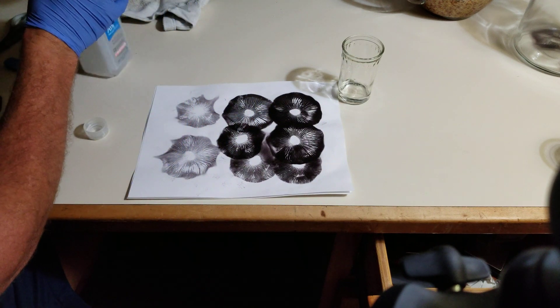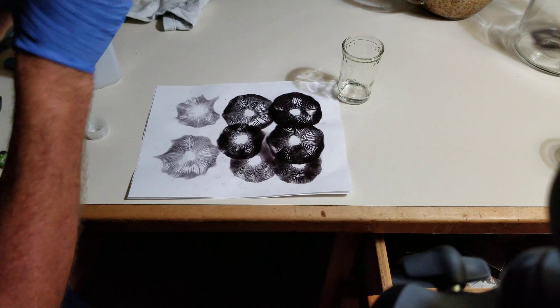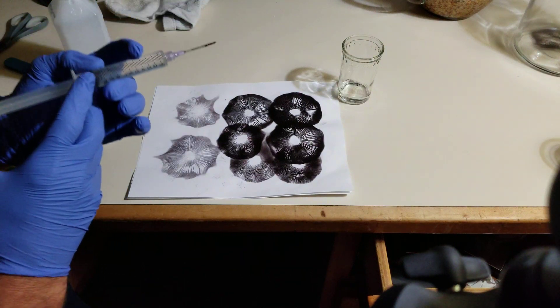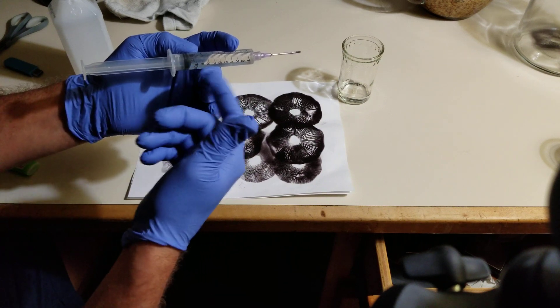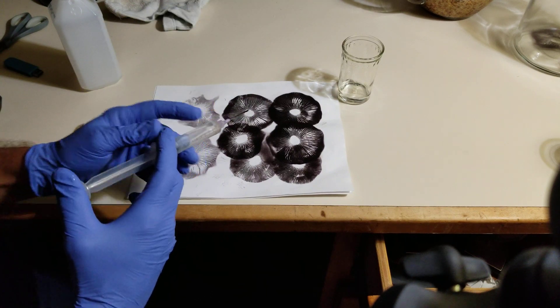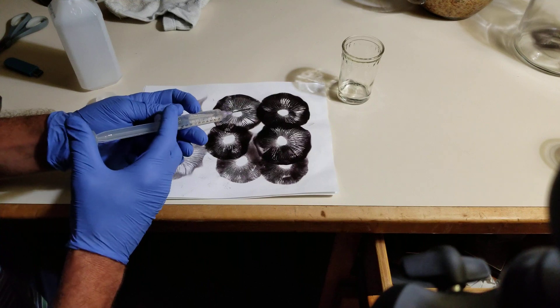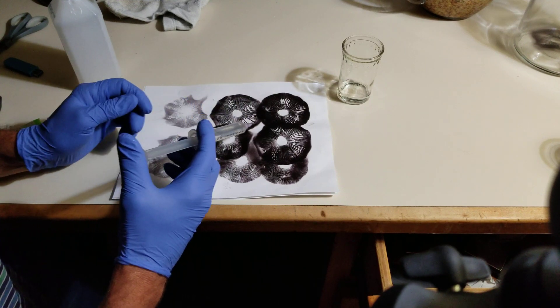I recommend to get two sprays of alcohol around your hands. It's not critical because there is no possibility of contaminants entering into the syringe except through the needle tip. We're going to squirt a little bit in — less than a milliliter, a very small amount of water — onto the print.